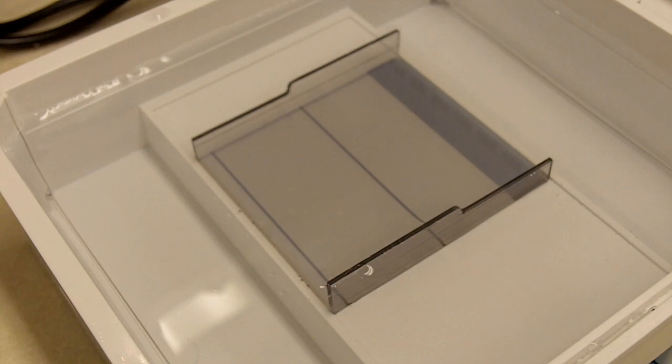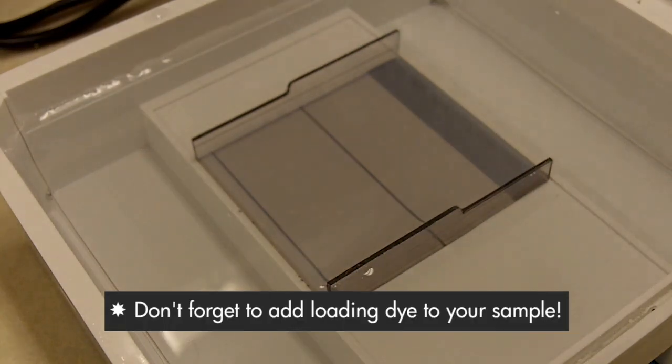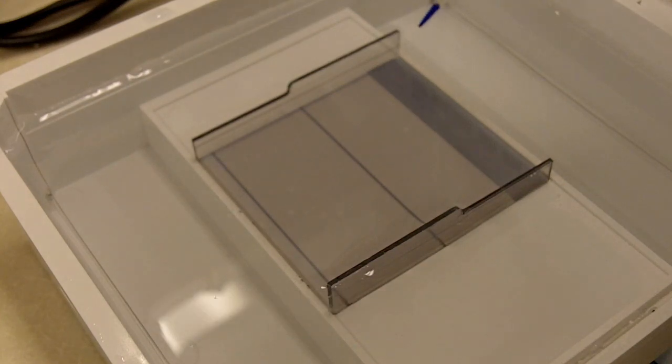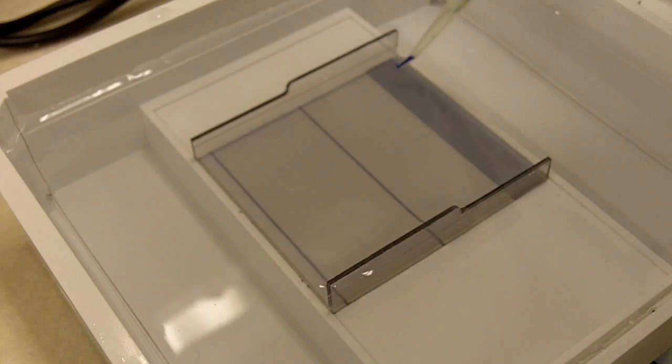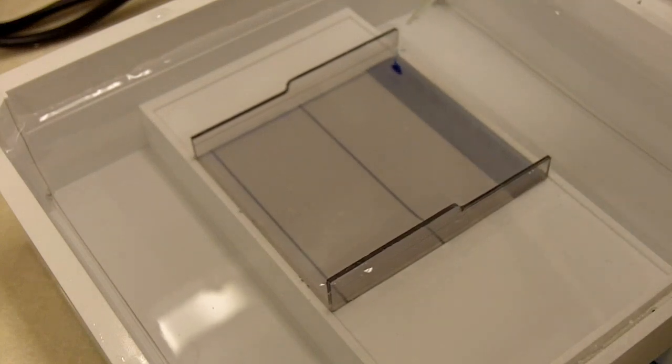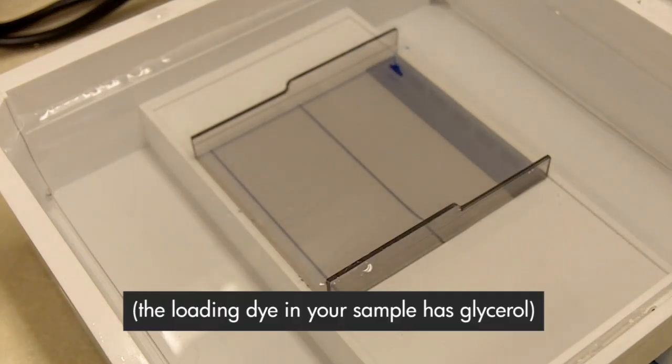When you load the sample, you want to have your tip inside the well but not to the very bottom because you don't want to poke a hole in it. Put your tip in the well and then slowly eject your sample like that. The sample has glycerol in it so it's heavier than water and it will sink right to the bottom of the well.